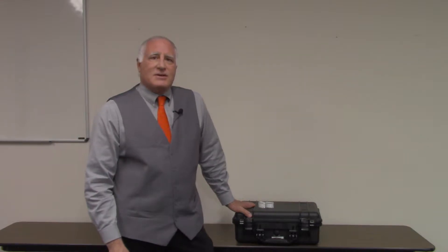Hello, I'm Michael Pinto, Wonder Makers of RML, and we're here today to very quickly show you how to take a Wonder Air Spore Trap air sample for mold safely and correctly.